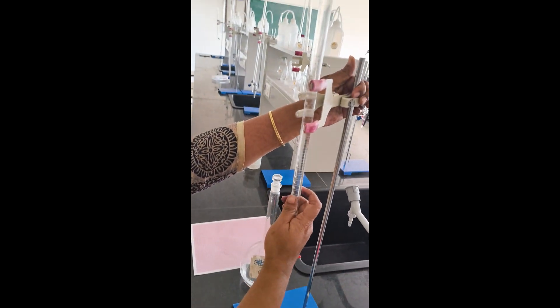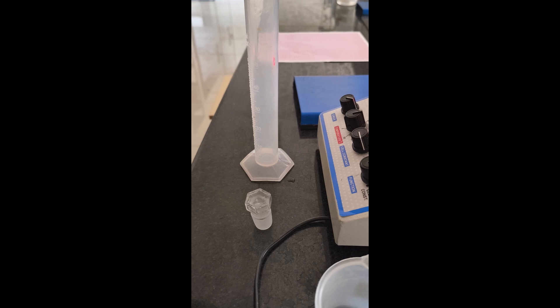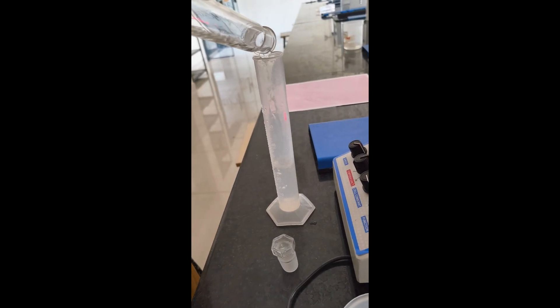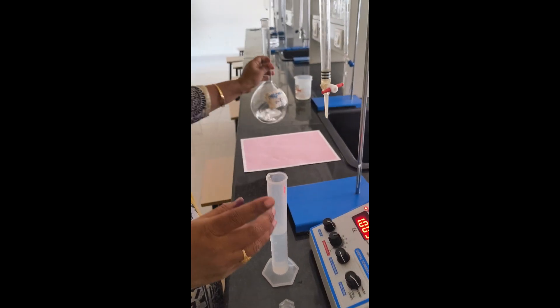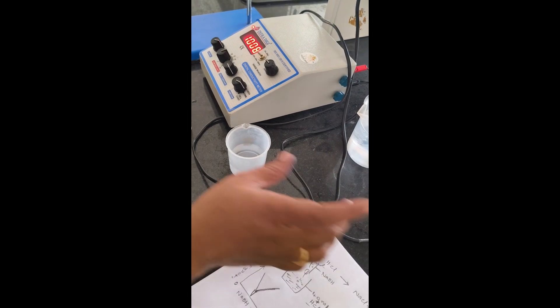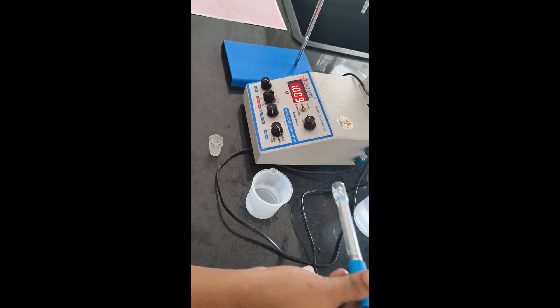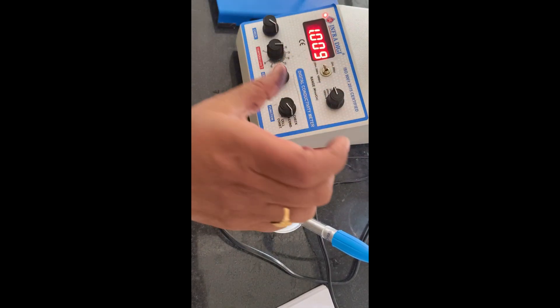Procedure: Fill the burette with NaOH solution. Take 40 ml of HCl solution into a beaker. Without adding NaOH, dip the conductivity cell into the beaker and note down the initial conductance of the acid.